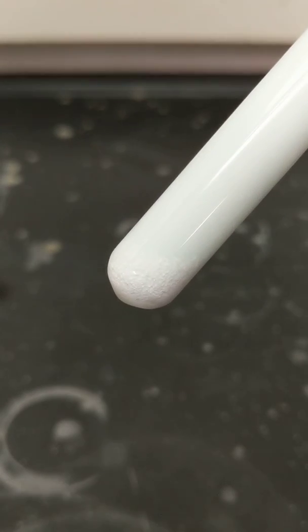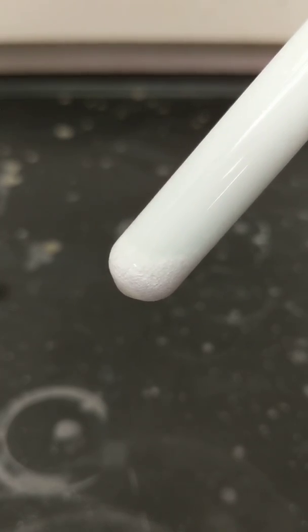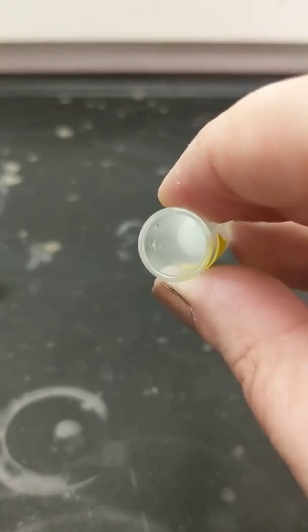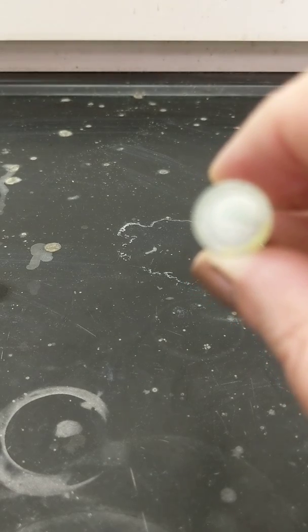Reaction 10 has noticeable powder particles on the bottom of the test tube as well as on the top.